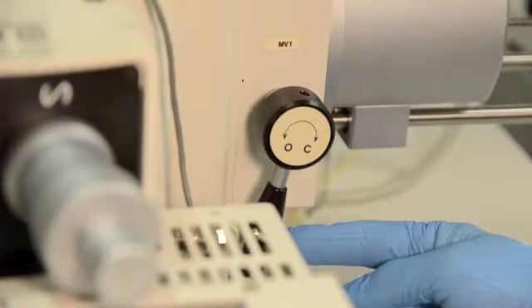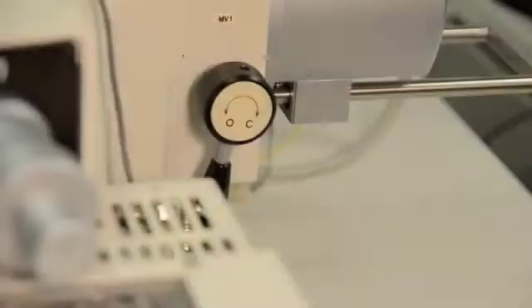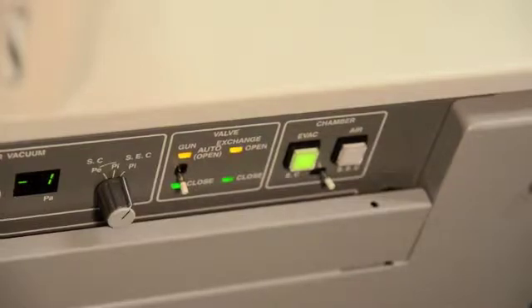Start by ensuring the MV1 valve is closed. Next, close the gun valve.